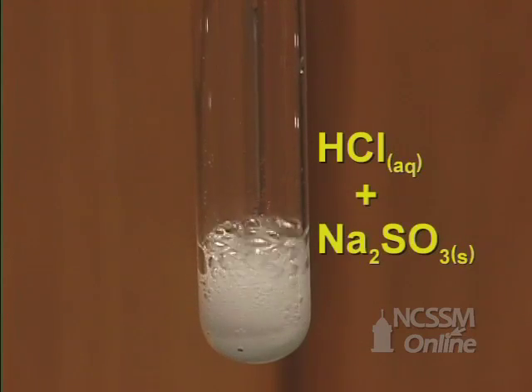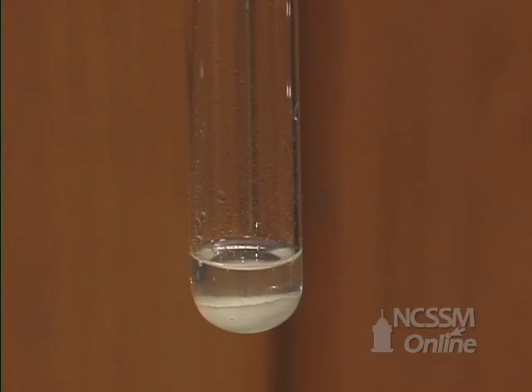The sulfite and the hydrochloric acid react to form sulfurous acid and sodium chloride.